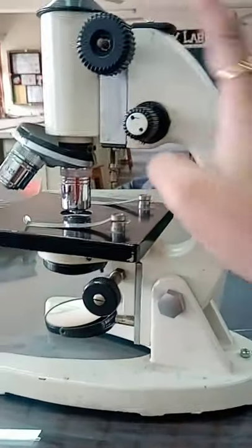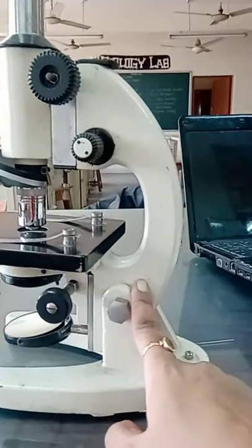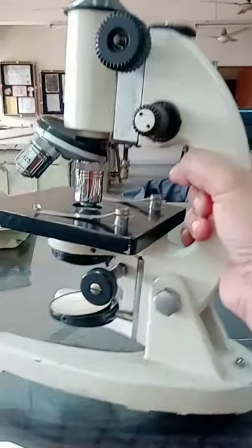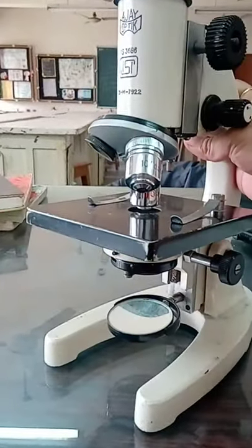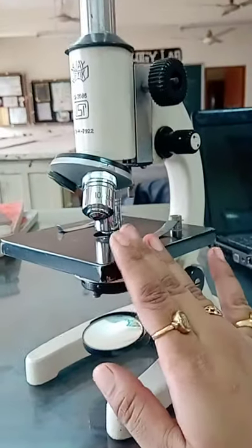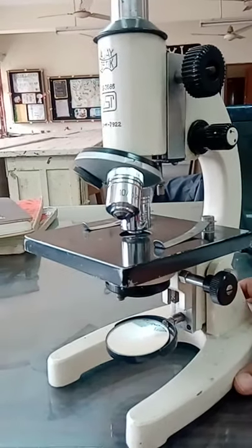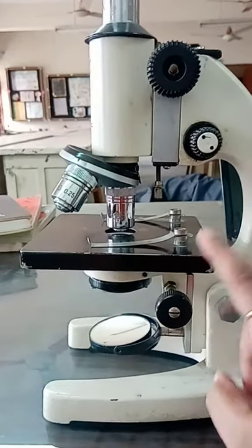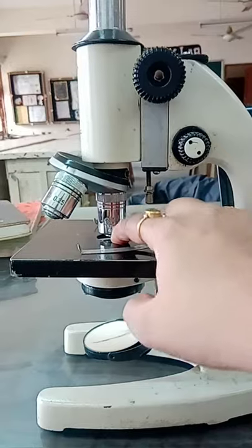This curved structure is called the arm and it is used to hold the microscope. There is one platform on which we keep the slide and observe it, and this platform is called the stage. It is rectangular in shape and also has a hole at its center.